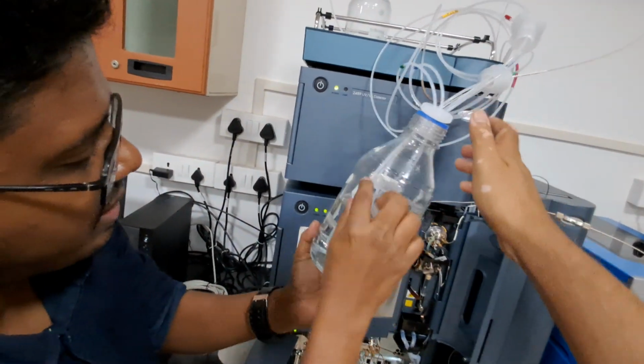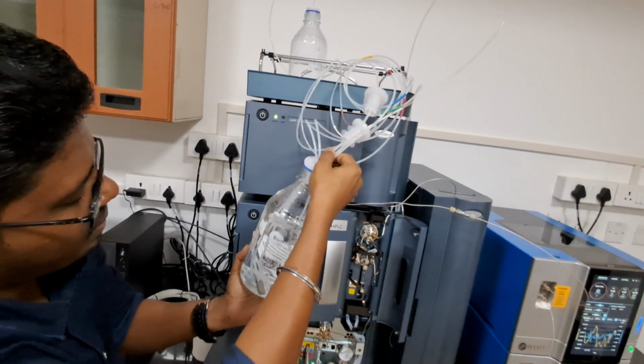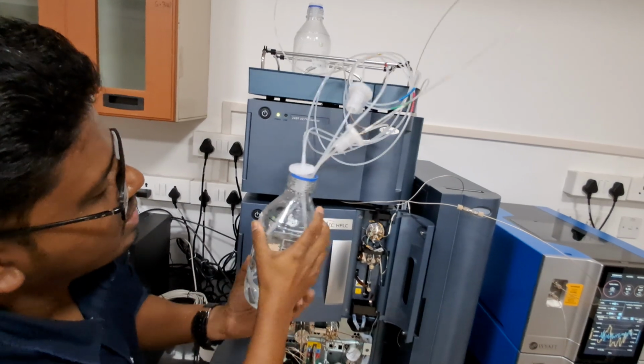That is a single connector. The connector will be dipped. And the solvent filter, you can furthermore dip it. That is not an issue. That is the one thing.